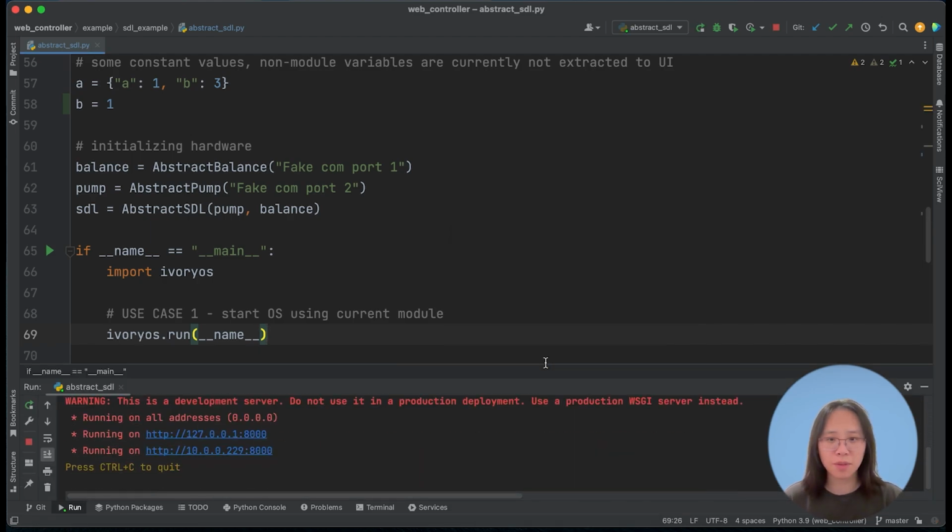So by running the script, it will give me two addresses. The first one is the localhost, and you can only access this through your local computer. But the second one will be available on your network, meaning any computer that's connected to your current network would have access to this address, and then should be able to control your current robotic platform. So I'll simply use the localhost link.